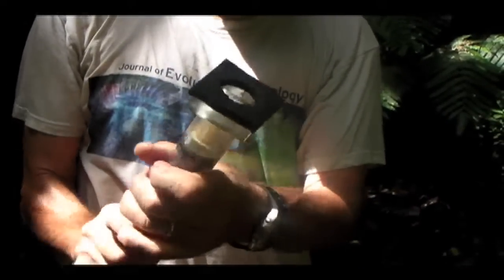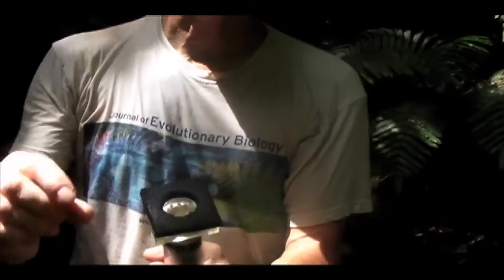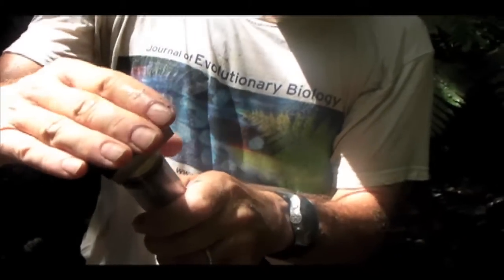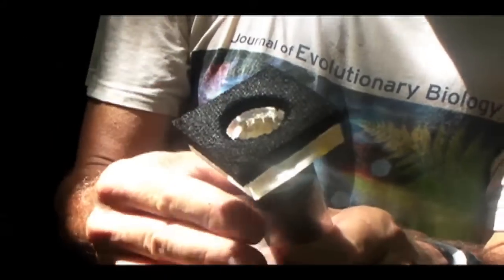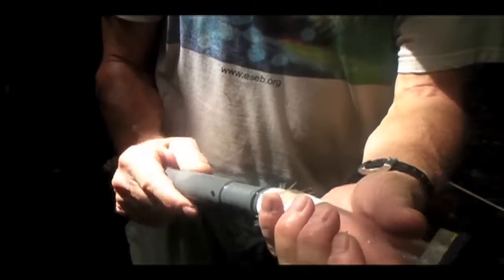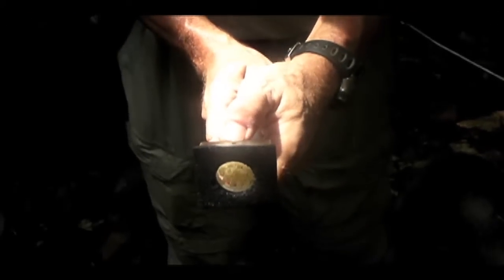The details of the structure are interesting. So, for example, it's got this collar of foam right here, and that's there so that it makes a good seal on the irregular surface that you're going to be adhering it to. And then the plunger has a rubber seal right here so that it makes a watertight seal against the length of the tube. And then it's got this little hole right here.